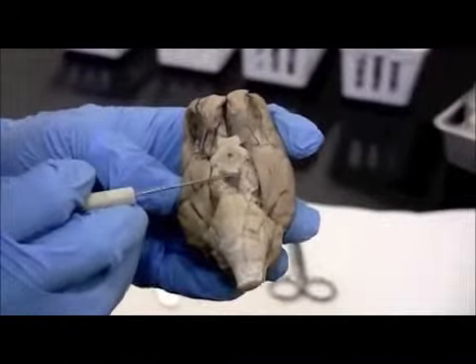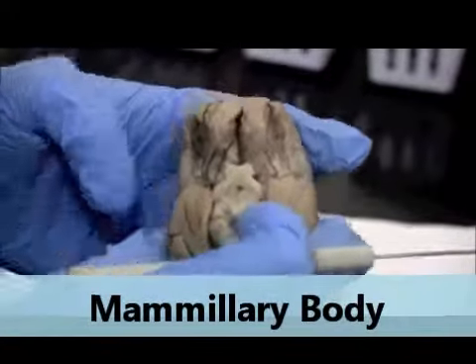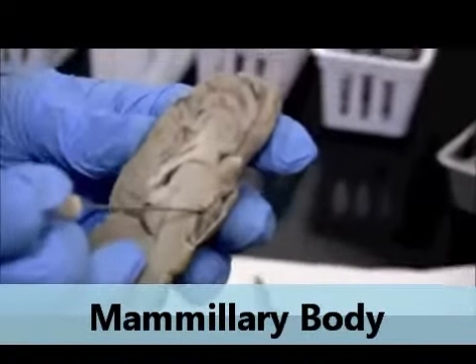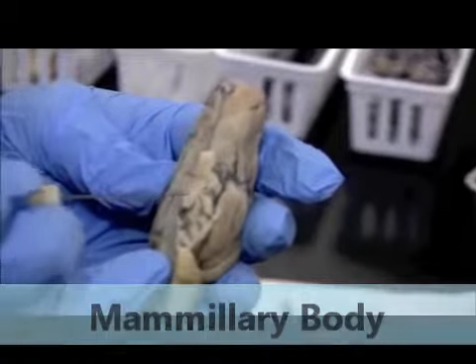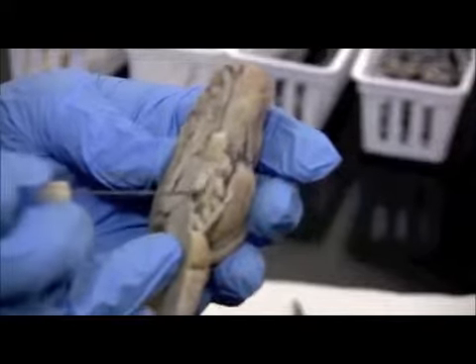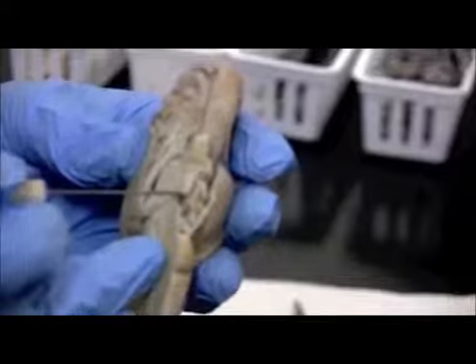So these mammillary bodies, it's kind of hard to see right here, but after we cut into the brain, let me go ahead and show you what it would look like. This little round piece right here is the mammillary body. And that would be the posterior border of where the hypothalamus is.